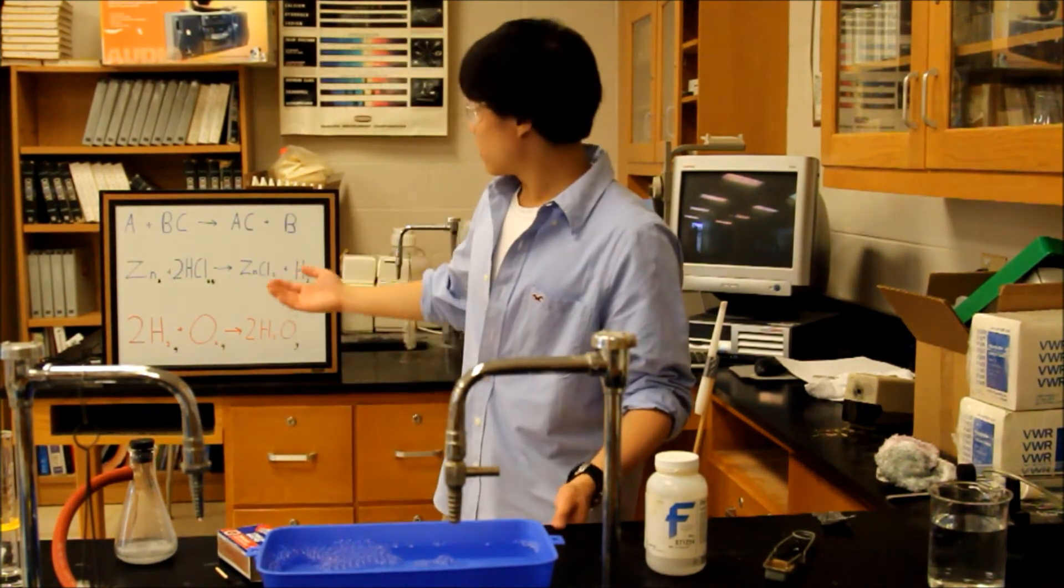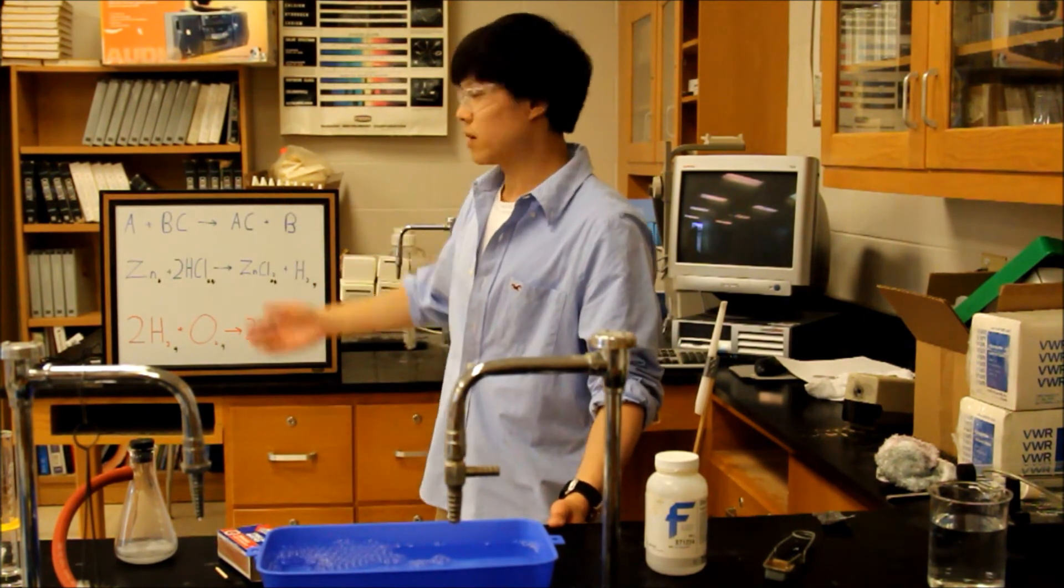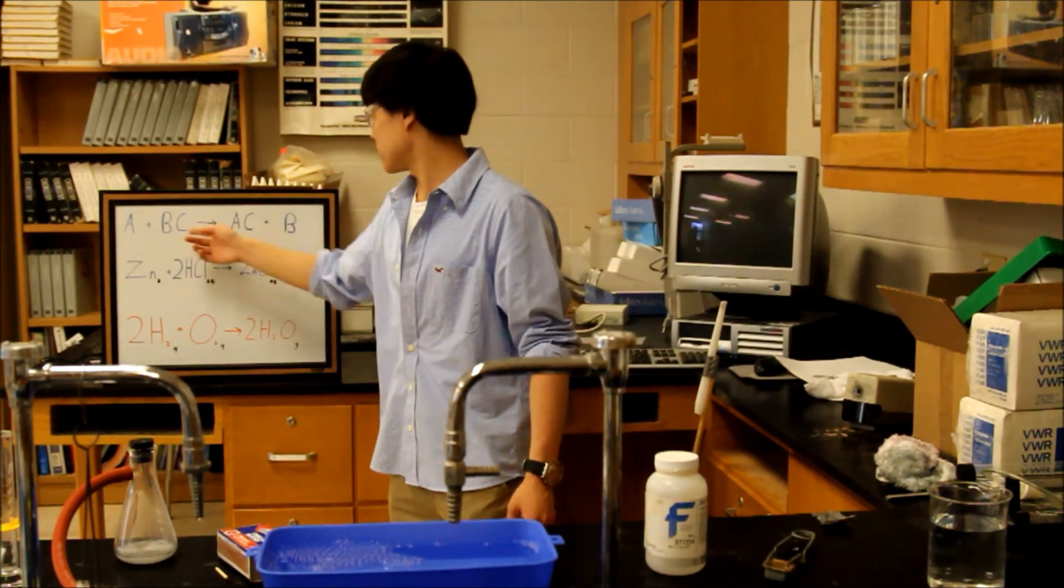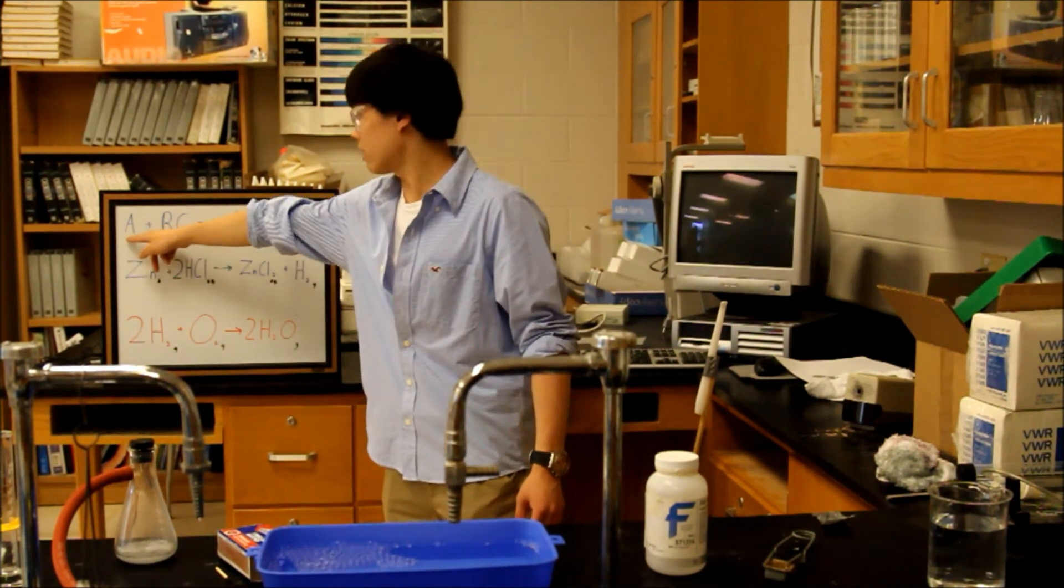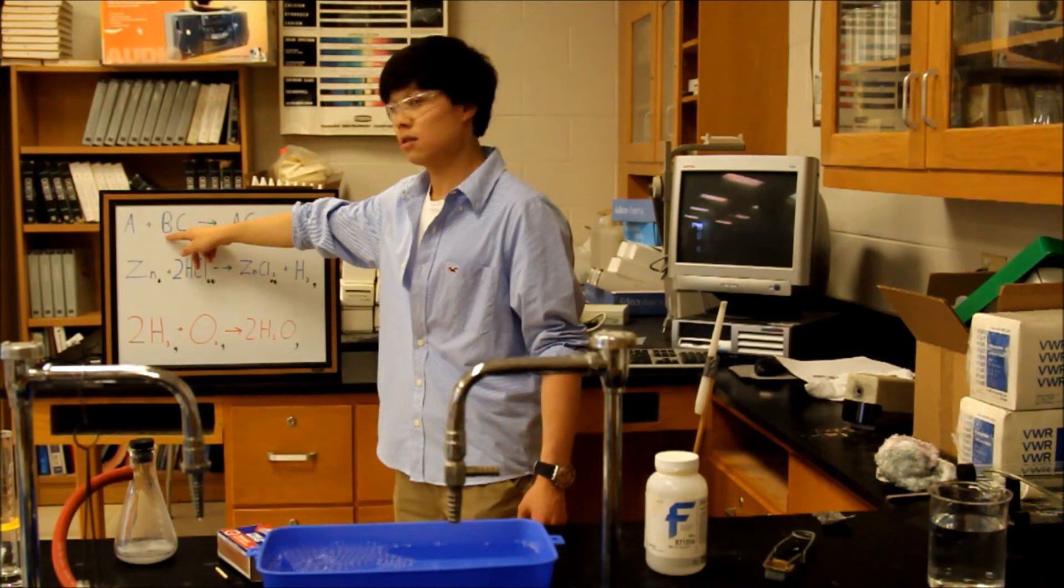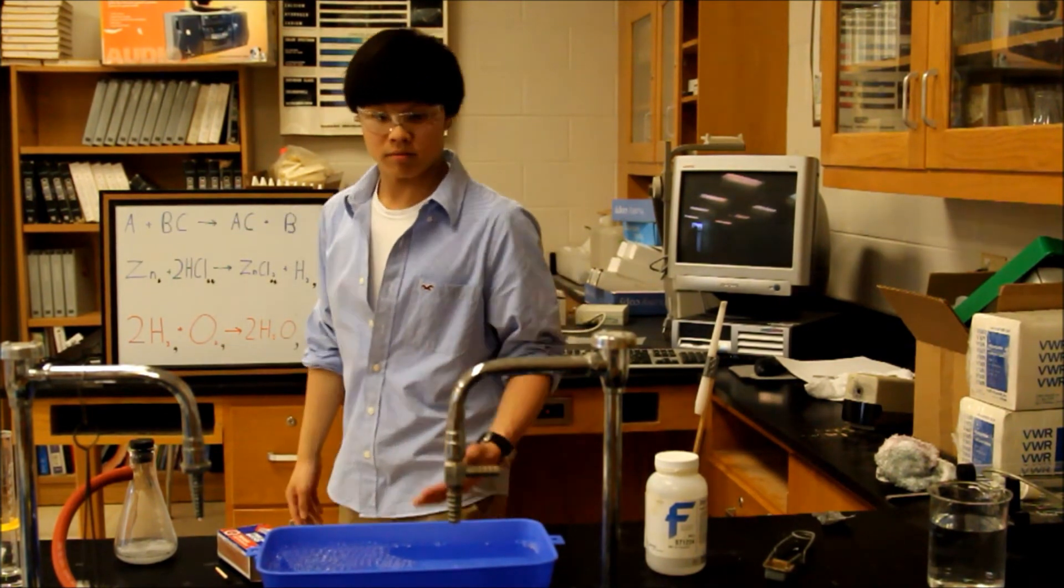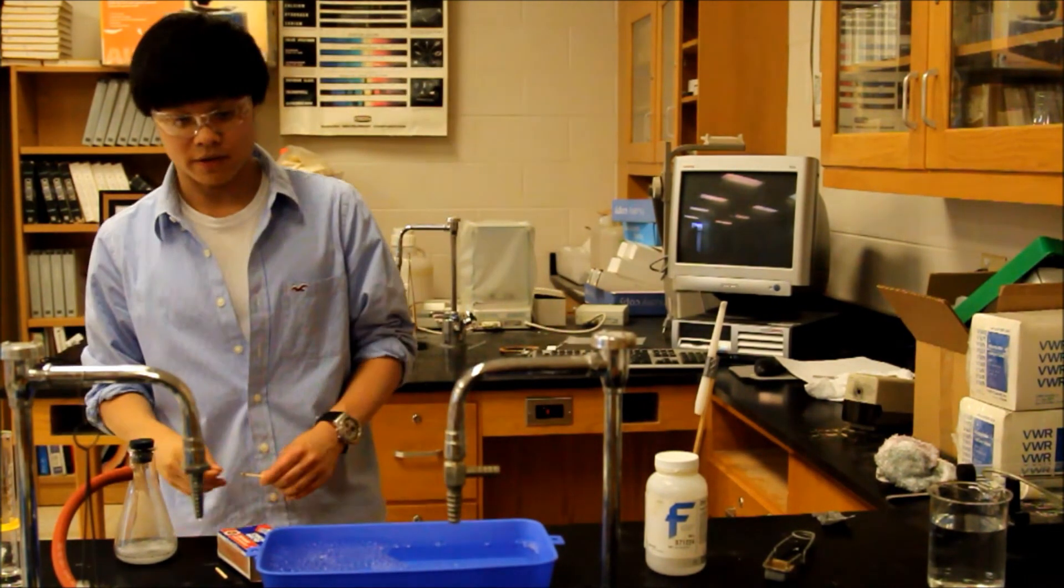That's your basic overview of single replacement reactions. It's easy to see where the name comes from. The B is replaced with the A, as long as A is higher up on the activity series than B. Might as well light the rest of these bubbles on fire since they're here anyway.